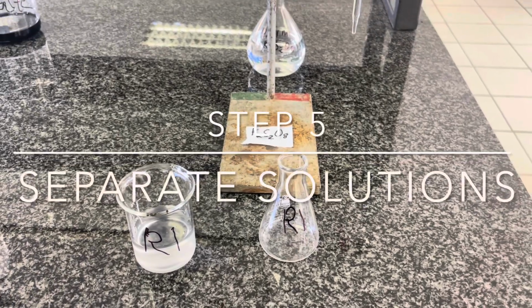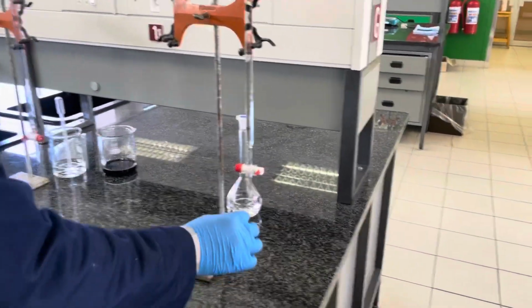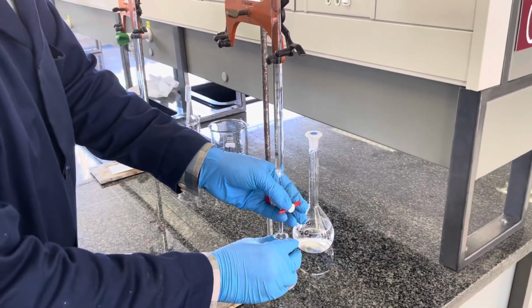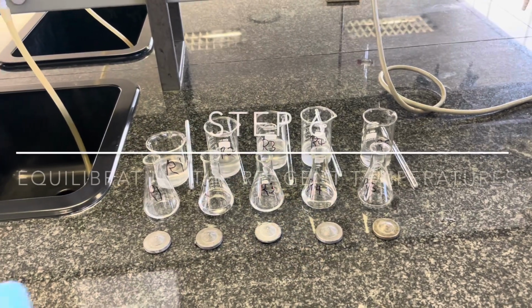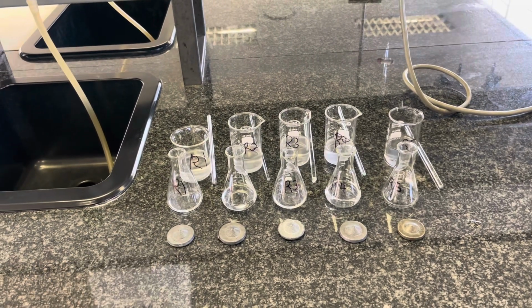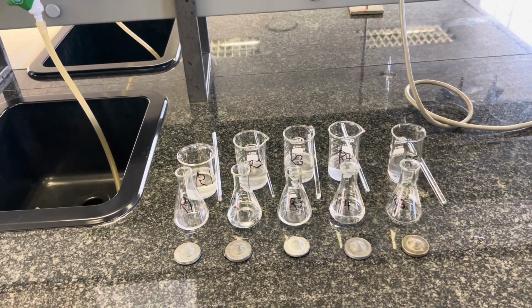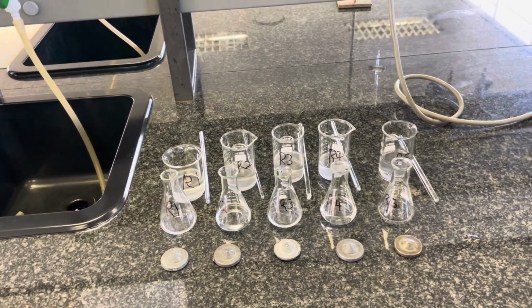Step 5 requires us to dispense different amounts of potassium persulfate into a 100 milliliter conical flask as indicated in the video. You will again use a Buret for this purpose. Now that you have prepared your 5 reaction mixtures as well as your potassium persulfate solutions, have them lined up and have a weight for each of these reaction vessels, as well as a stirrer for each of them.